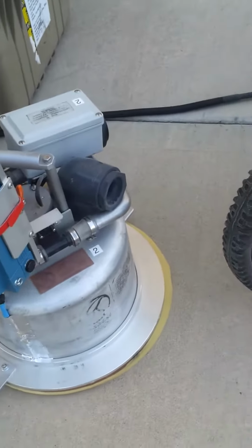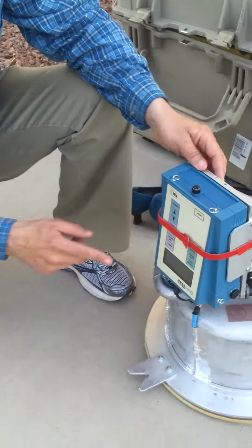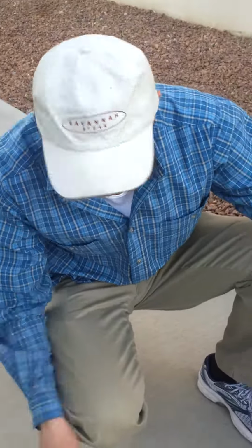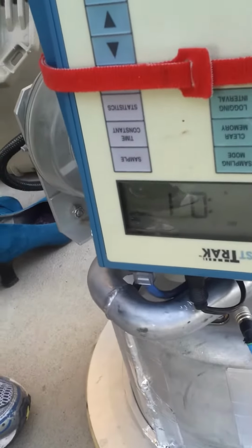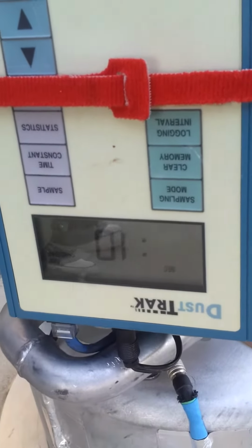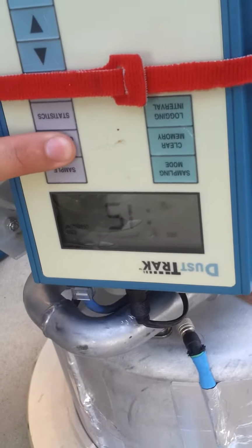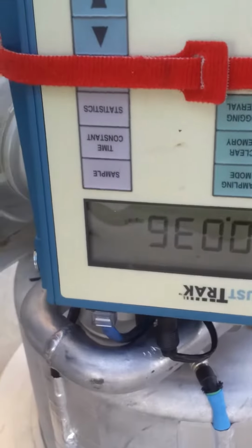And one thing to check, even though this doesn't change unless you press it, there's a time constant button, and this is basically a running average. So you want to be in the 1 second mode. Okay, see. So you press this thing, it goes to the different things. So if I want a 10-second running average, I will leave it there. So that's 15, 30, and we want to be in 1 second mode. So that means it's not doing any averaging.